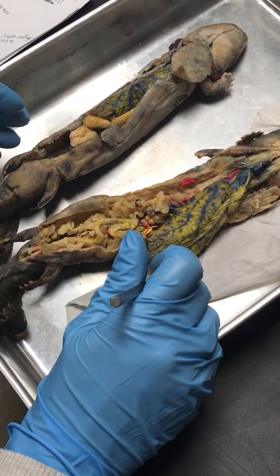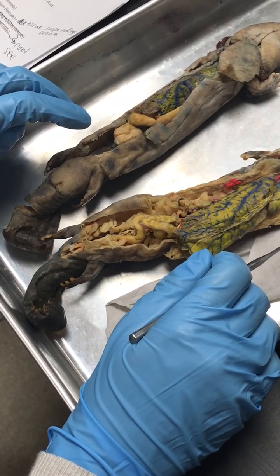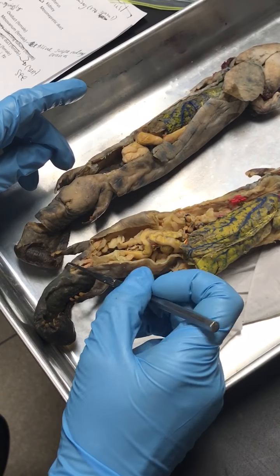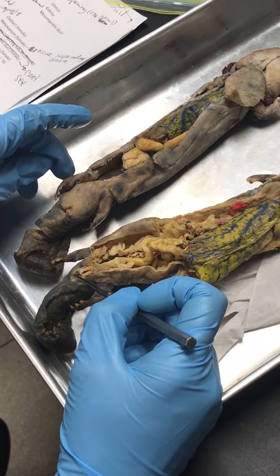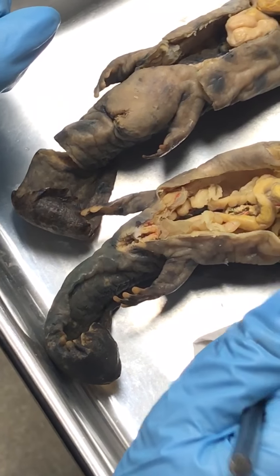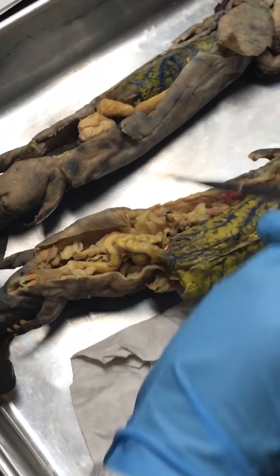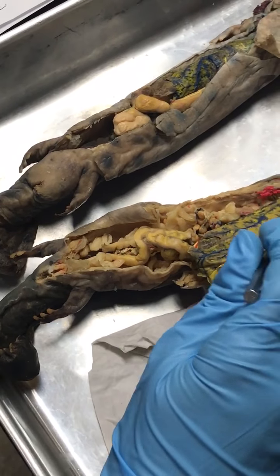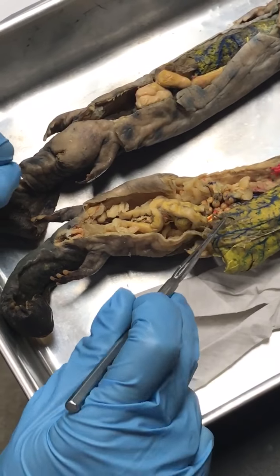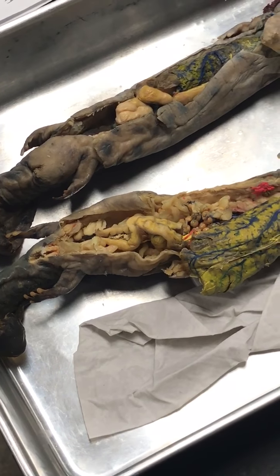And then these guys have internal fertilization. So the males make a spermatophore, which is like a packet of sperm. Travel out of his cloaca into the female's cloaca. She has cloacal papillae inside that help bring in the spermatophore. So that's just inside. And then the egg will travel through the oviduct and collect jelly and then get fertilized in there and then come out the cloaca. So internal fertilization.